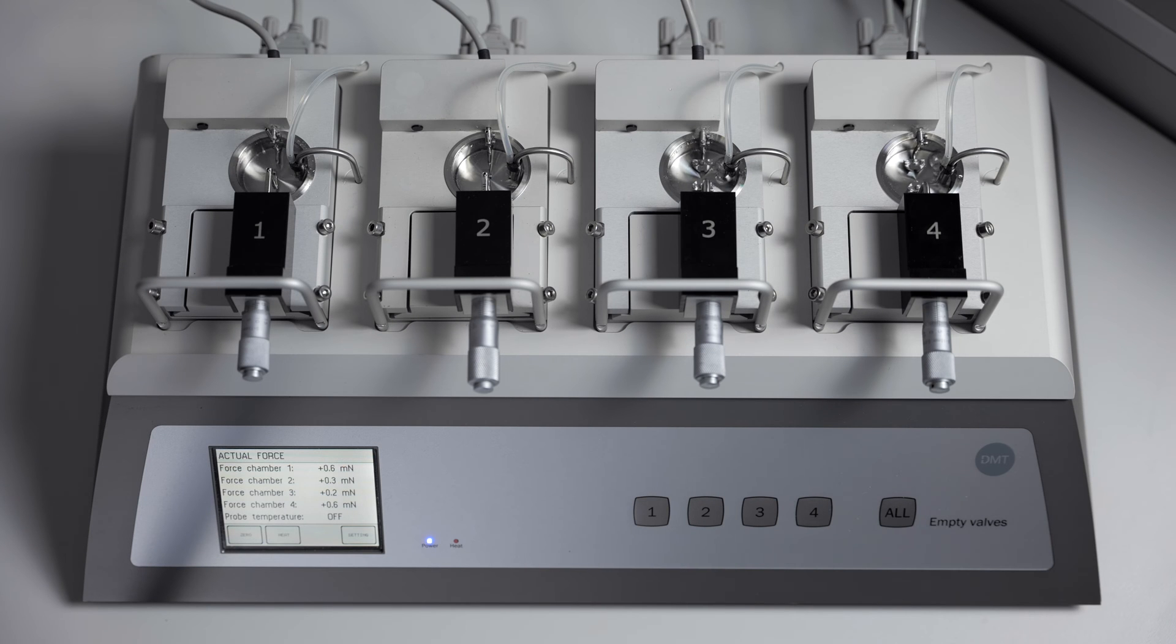In this video, we will go over the protocol for troubleshooting a clogged gas line or lack of bubbling in a chamber. In this case, chamber 2 here.